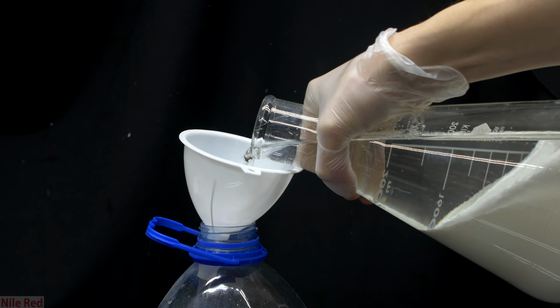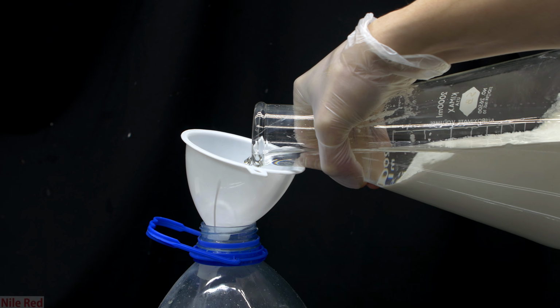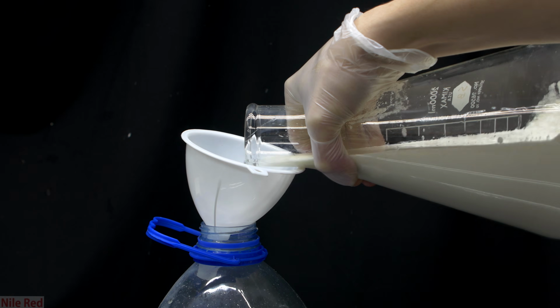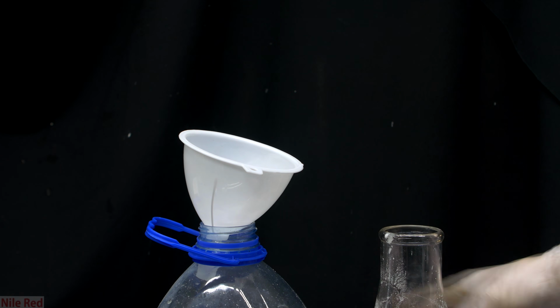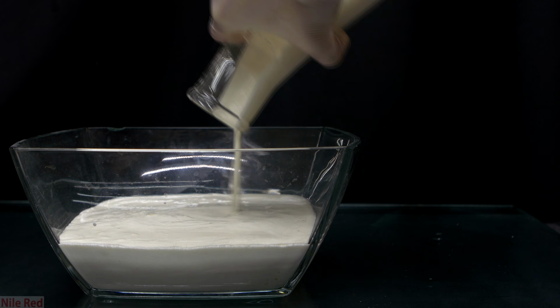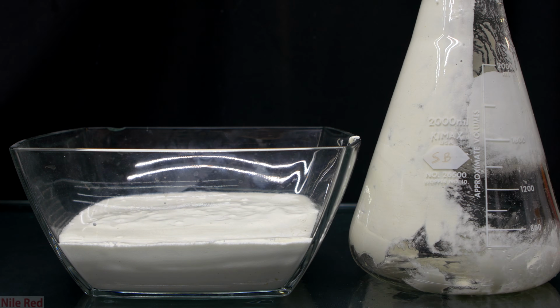We're eventually left with a large water layer, and this is poured off into a mercury waste container. It's really important, for obvious reasons, not to pour this down the drain, because you'd be contaminating the sewer system with mercury. I really didn't want to have to filter a mercury salt, so I thought I'd get away with it by simply pouring it into a dish and letting the water evaporate.